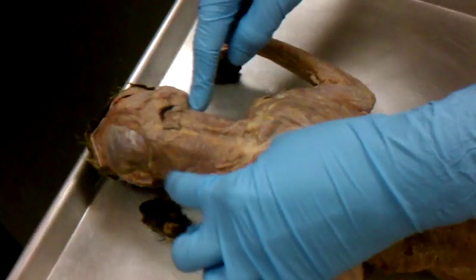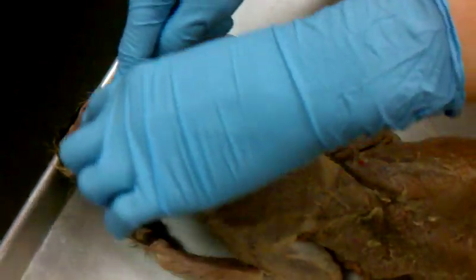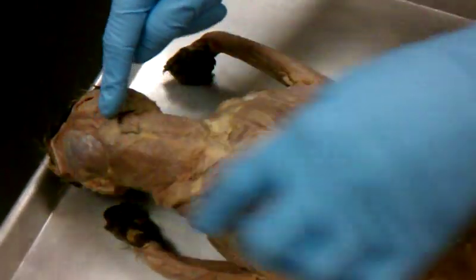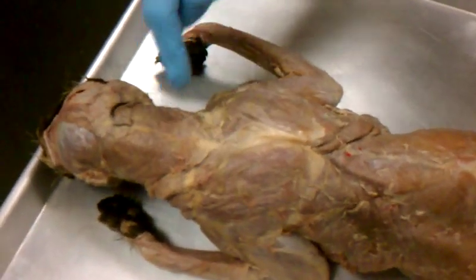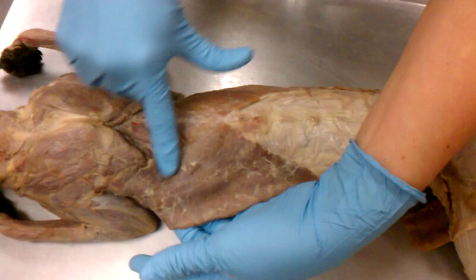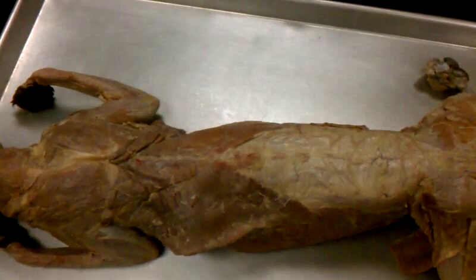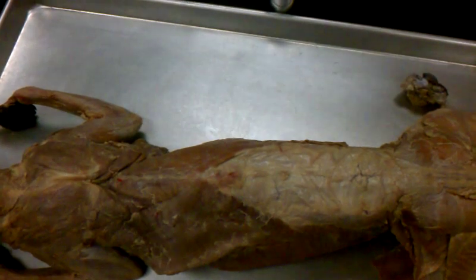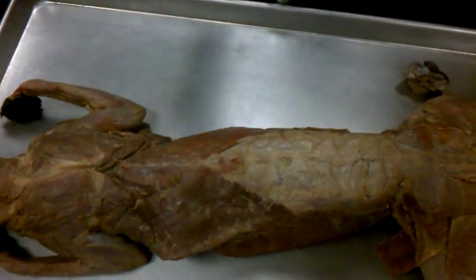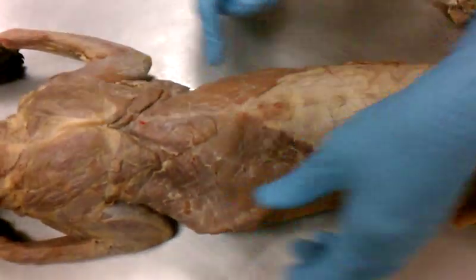What is this one? Is that the trapezius? Trapezius muscle. It forms like a trapezoid. So that's the trapezius. And while we're back here, what's your main back muscle? Look, when you work out your back, and you're like, yeah, my back's hard. Your lats. Right here, those are your lats.